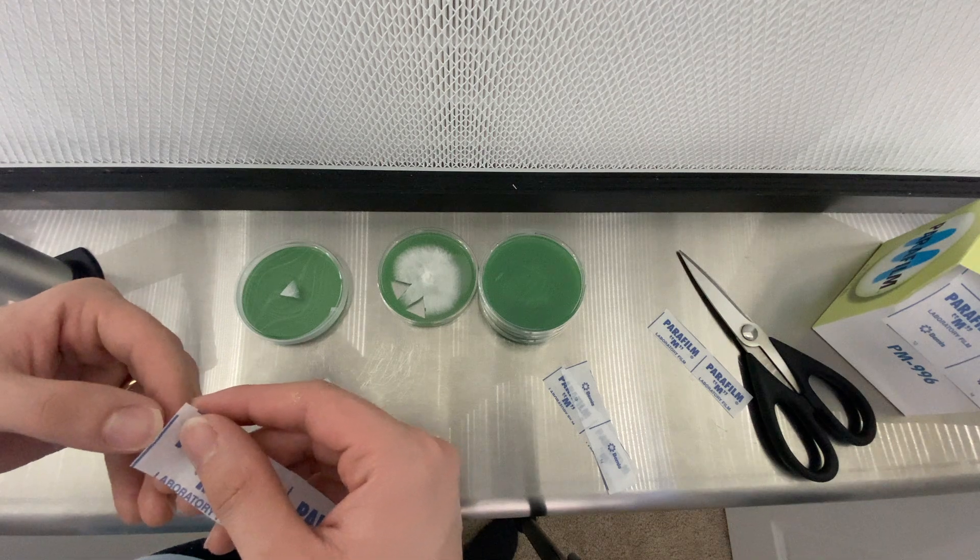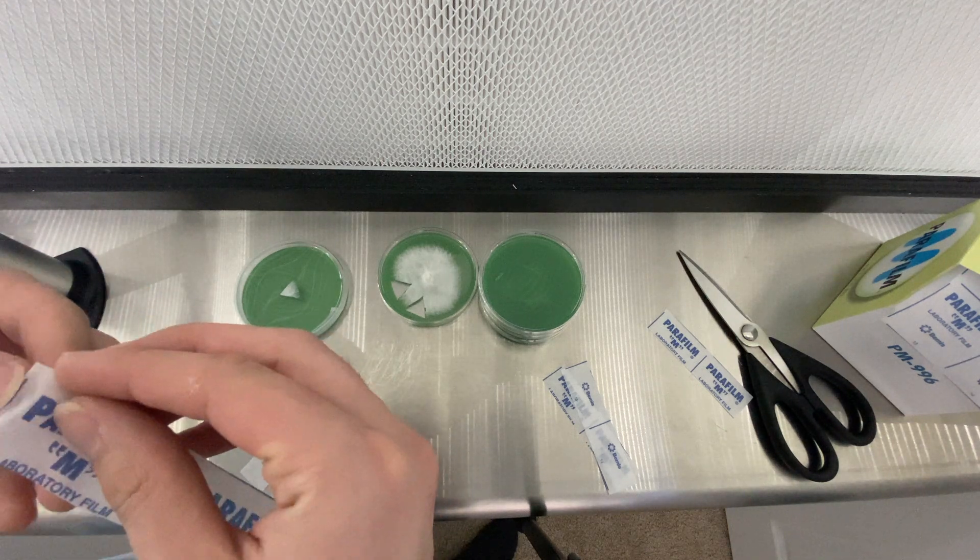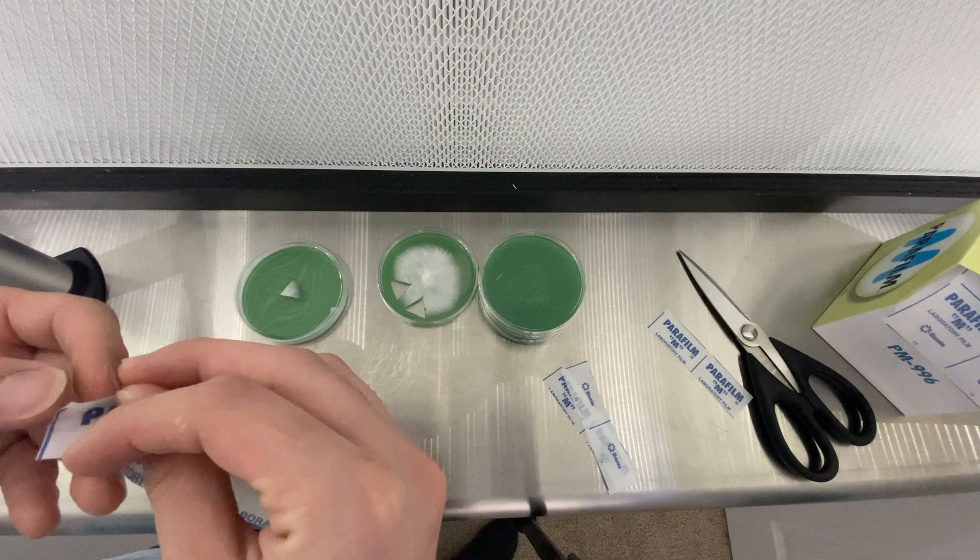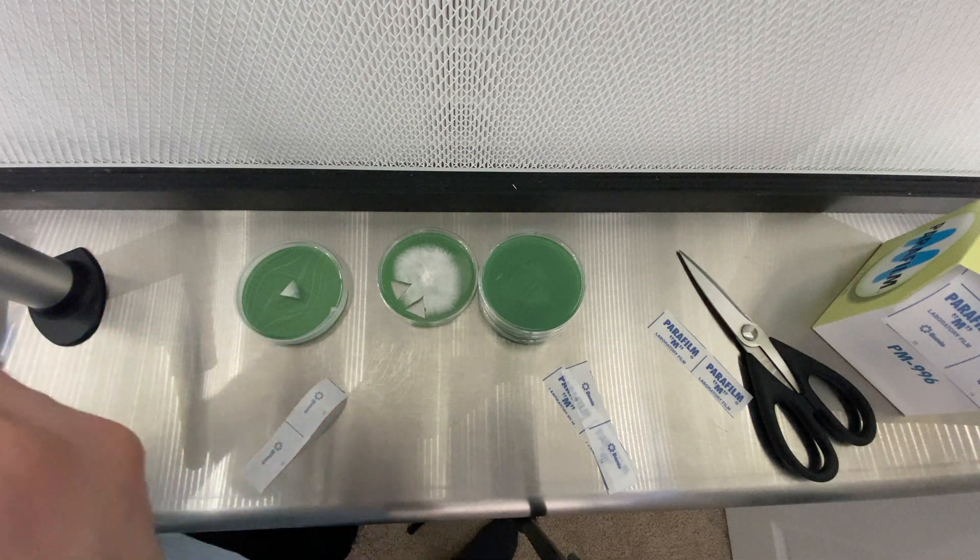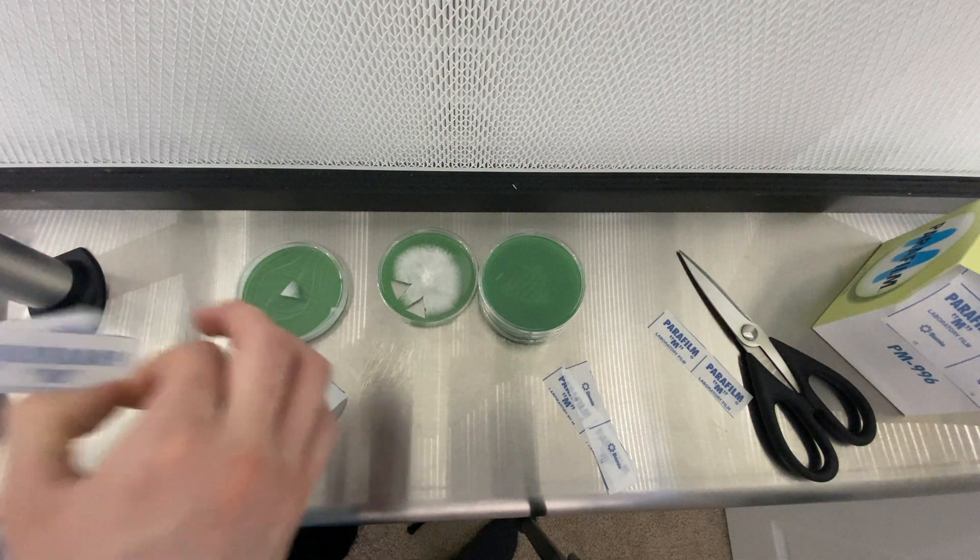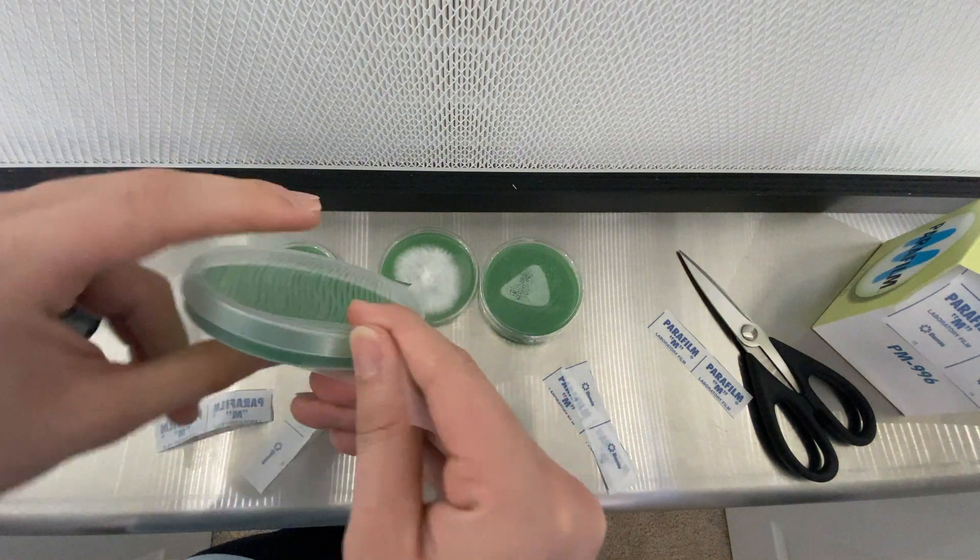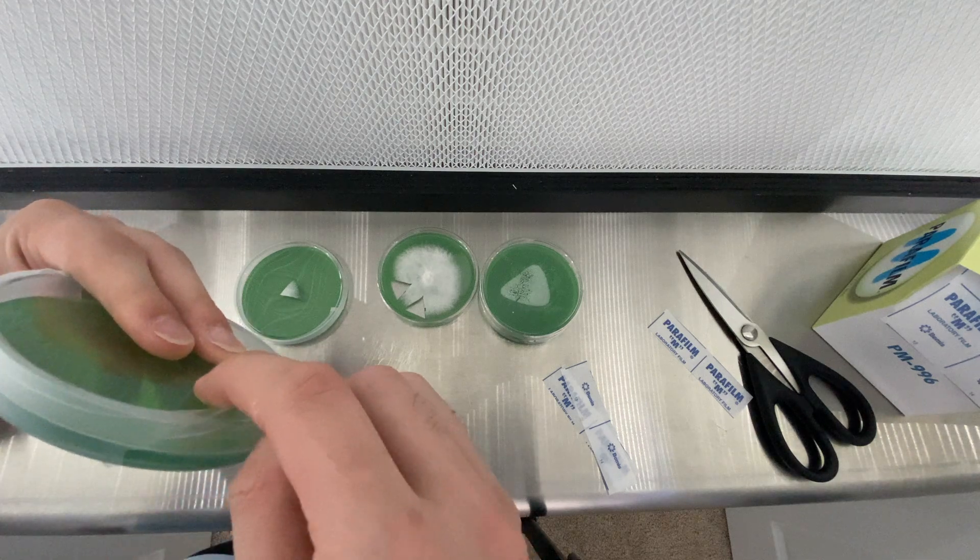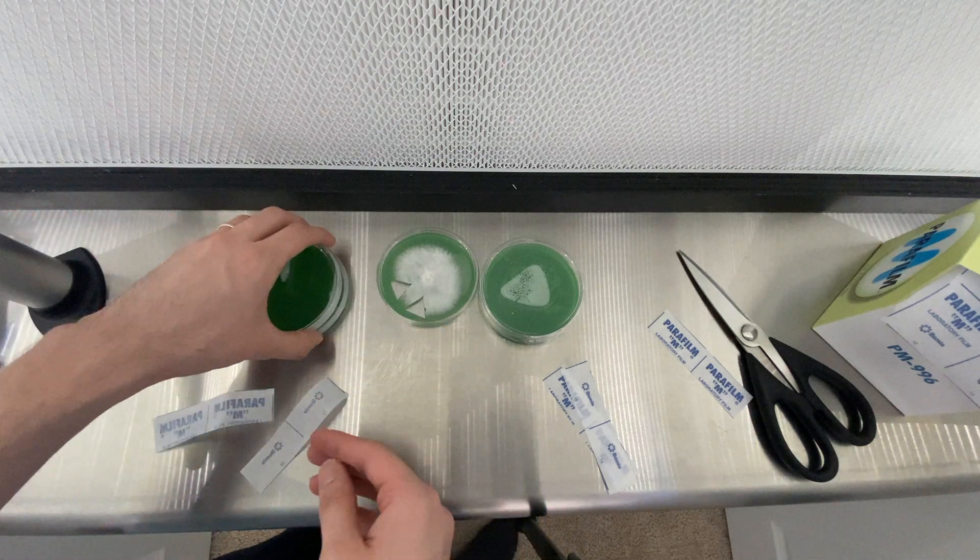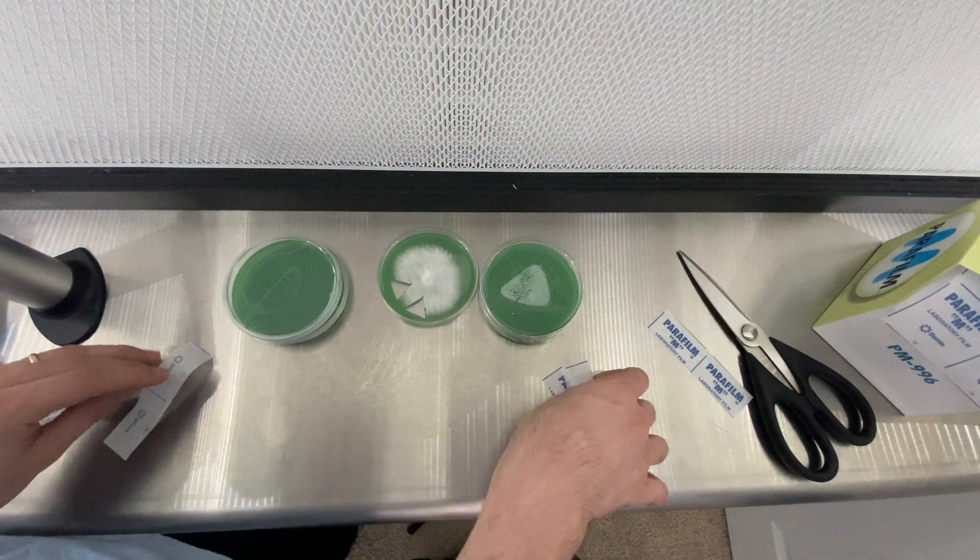But I use the inside of the parafilm on the outside of the plate. I'm gonna let it play here for a second as I finalize the plates, so enjoy some plate ASMR.